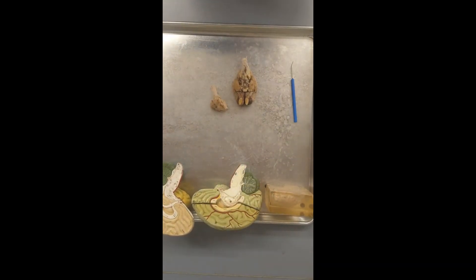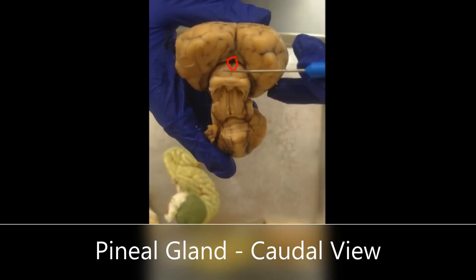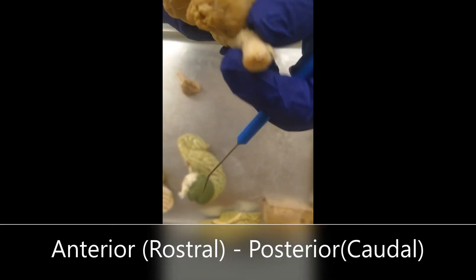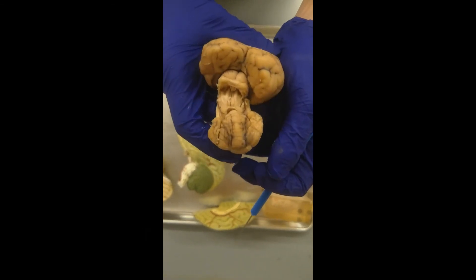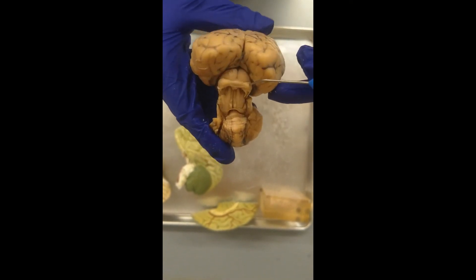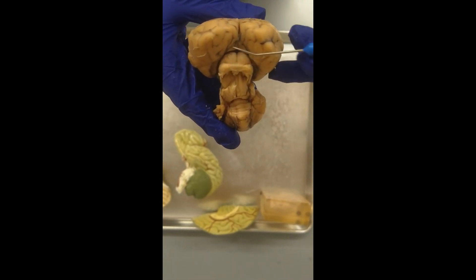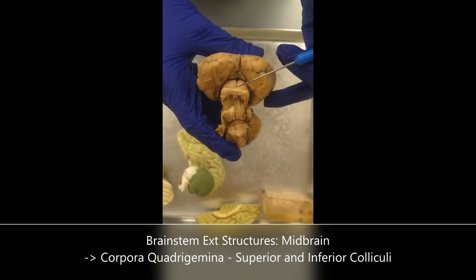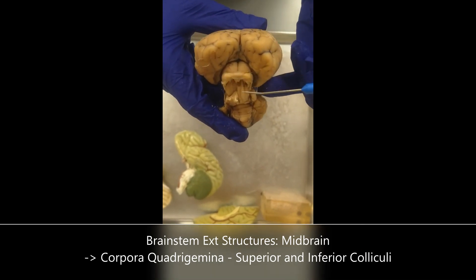That covers internal and external structures of the diencephalon. Now, this is the cerebellum — anterior and posterior surface of the brain. Reflecting the cerebellum a little bit, you're going to see four little mounds — two superior and two inferior. All four of these make the corpora quadrigemina. The two on top are going to be the superior colliculi, and the two on the bottom are going to be the inferior colliculi.